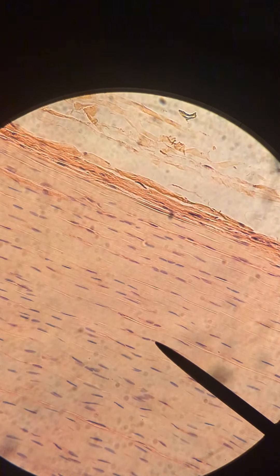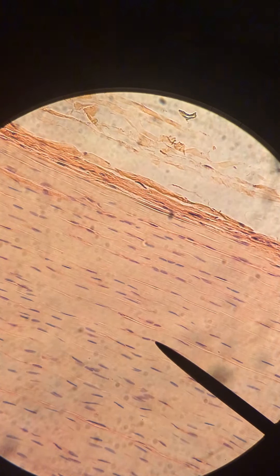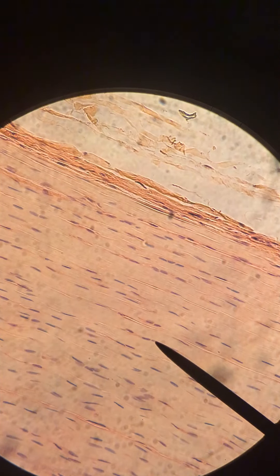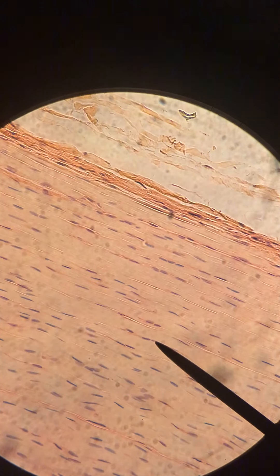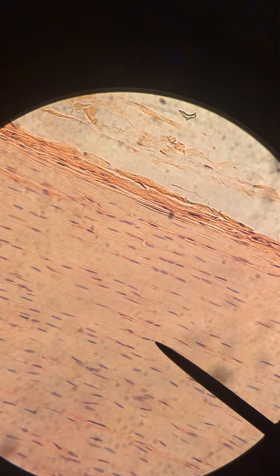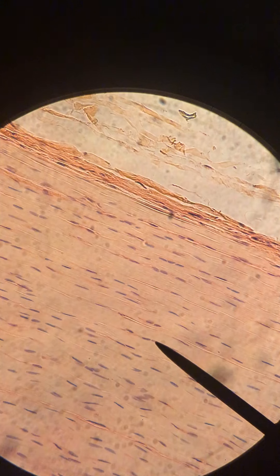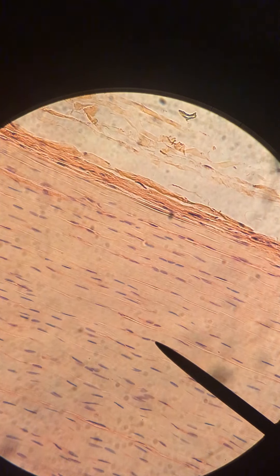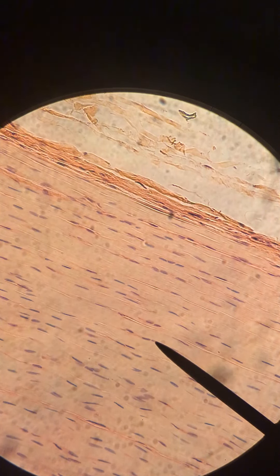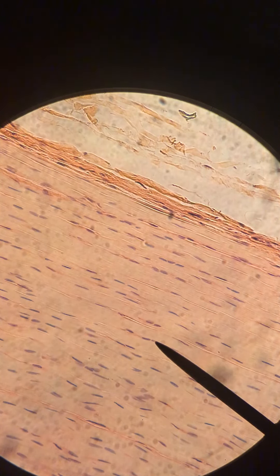So just a tip to help you tell them apart. That's it for slide 10 — we've got regular dense connective tissue. The pink is obviously our collagenous fibers and the nuclei belong to the fibroblasts.